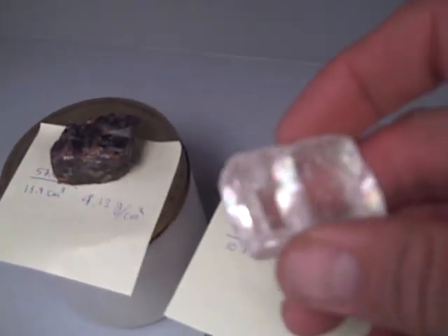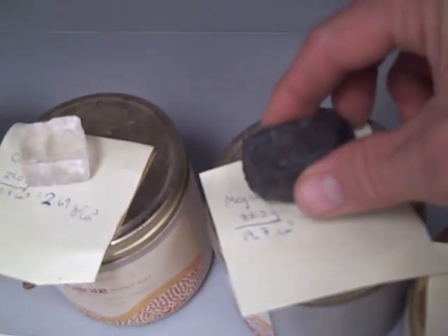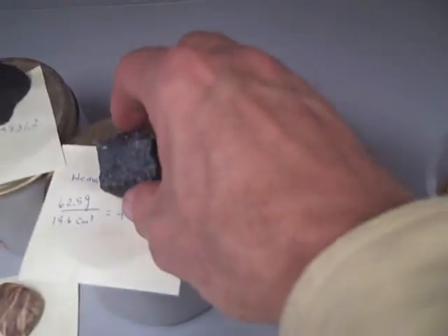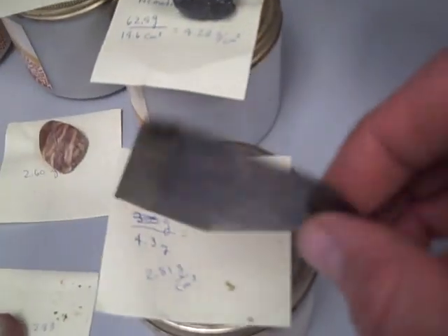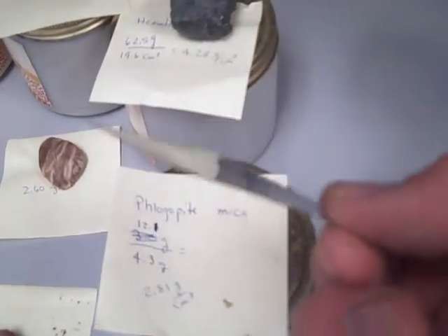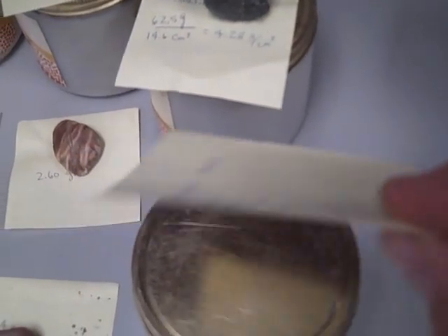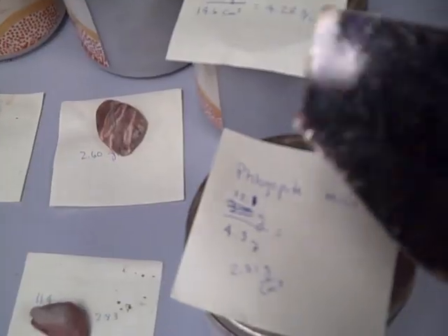The calcite, 2.69. The magnetite, 4.48. Hematite, 4.28. And the phlogopite mica, which looks like it's as thin as a sheet of paper and looks like it would have a very low particle density, but it has a particle density of 2.81.